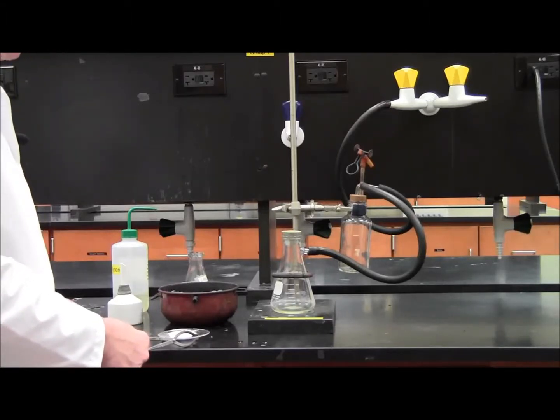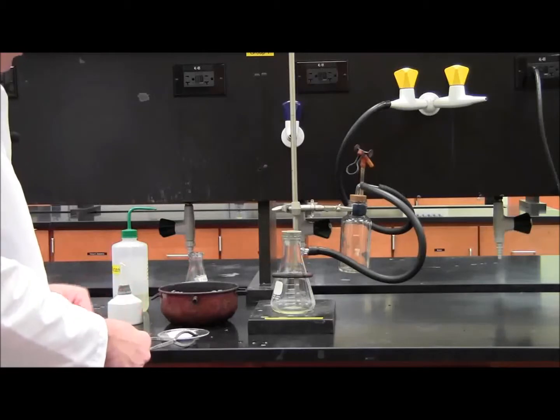You are done with the first part of the experiment. Show the crystals to the instructor.